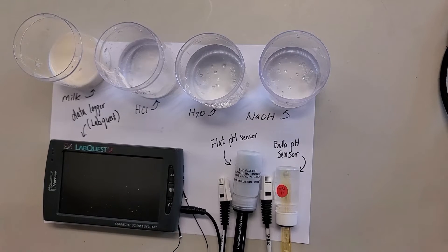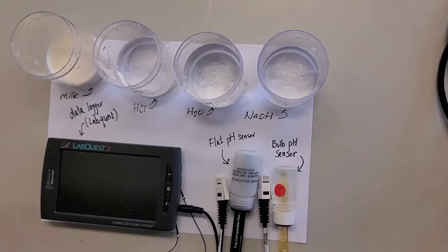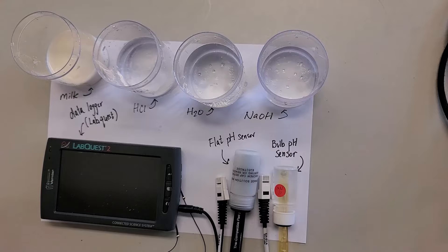Hi there, Ms. Lambs here. So in the second part of the video, we're going to show you how to use the data logger to measure the pH of solutions.